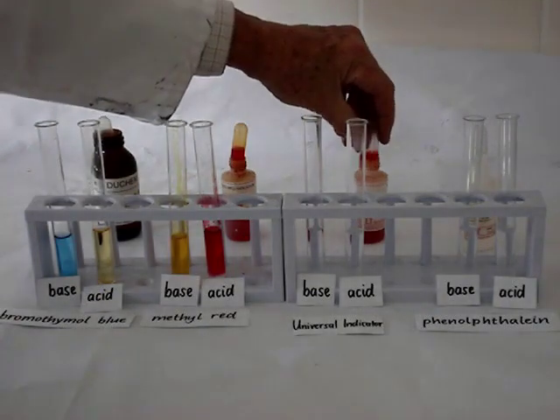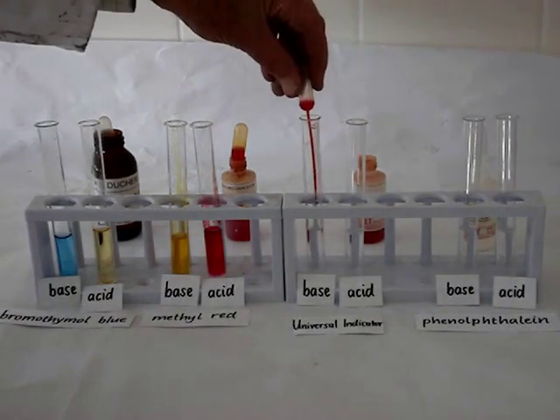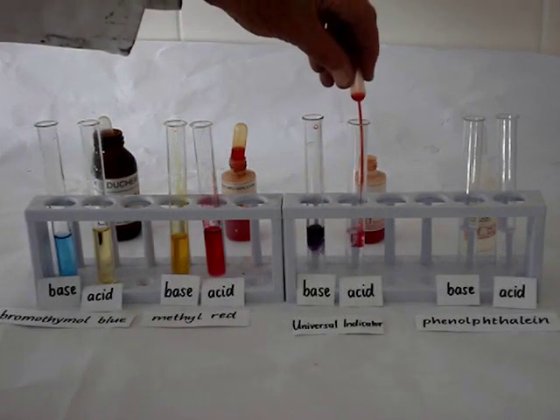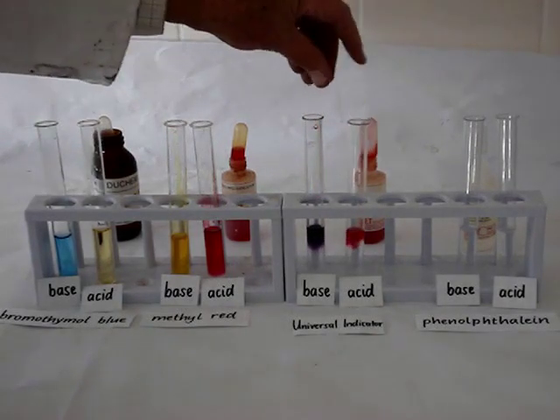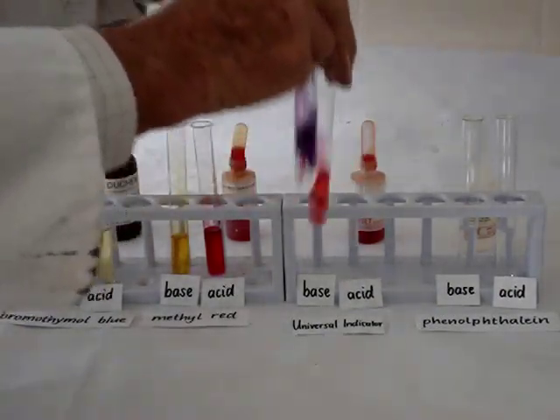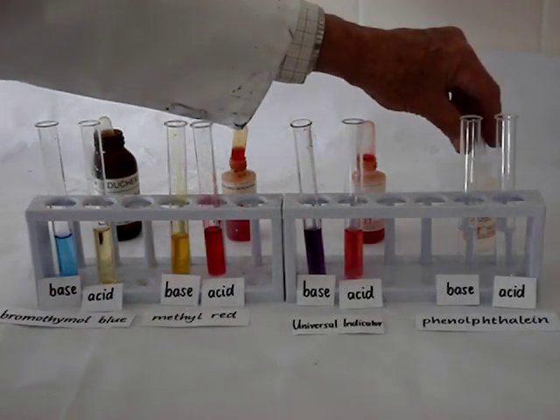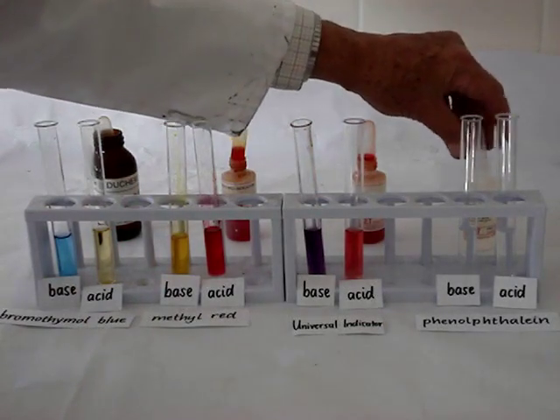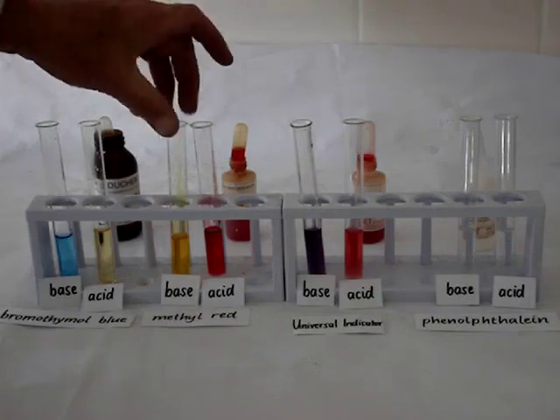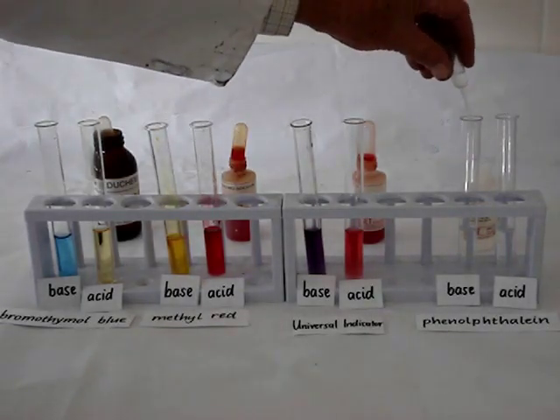Universal Indicator. In a base, it depends how strong the base is. This base is obviously quite a strong base and turns it purple. Weaker bases, or bases with a lower pH, would have turned it blue. And this acid turns the Universal Indicator red.